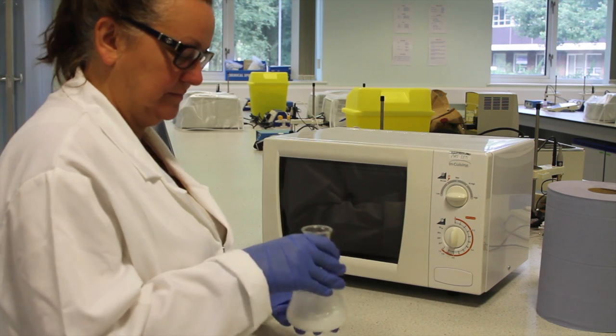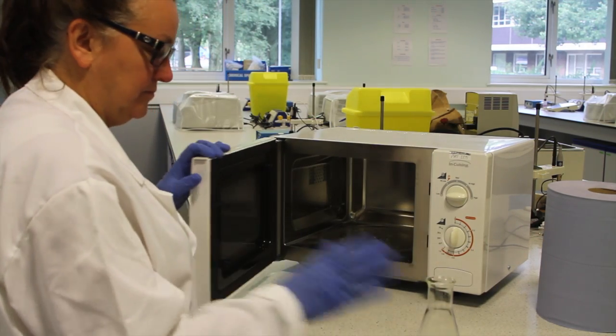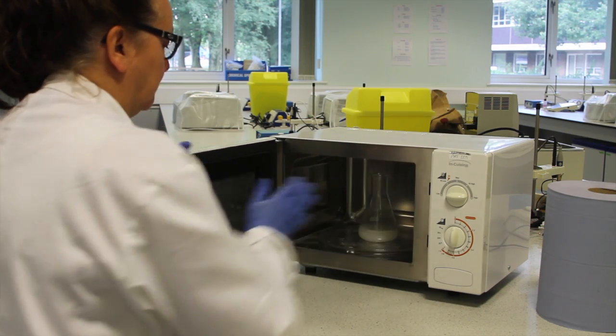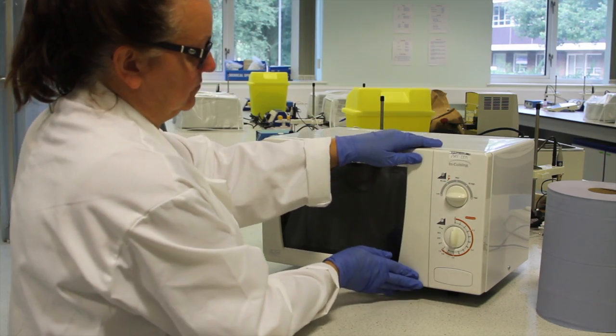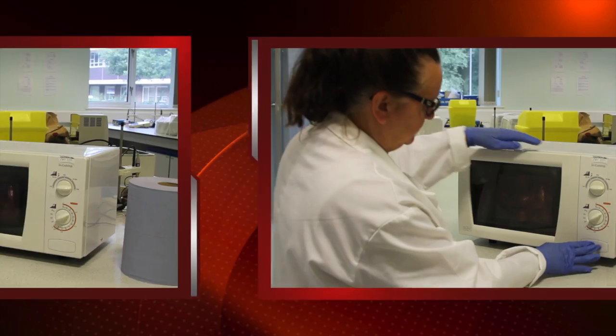Once the solution is prepared, the agarose needs to be dissolved in the buffer. This is done by heating the solution using a microwave for a few minutes. Take care not to boil the solution and keep checking every 20 seconds or so.